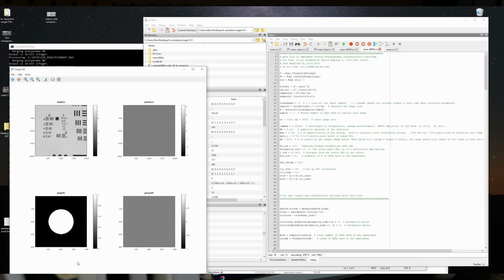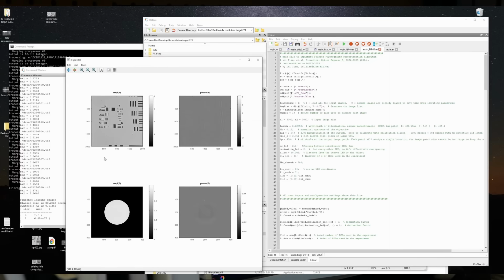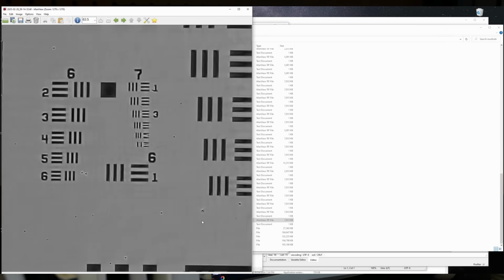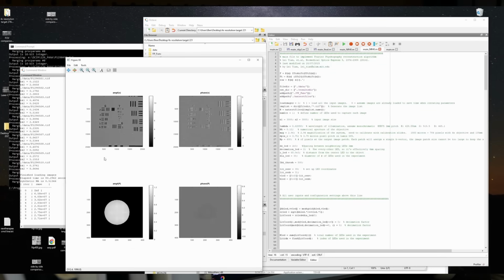Now the challenge is that we need to know the phase information to do the inverse Fourier transform, and we don't have it. There's no way to get it because we don't have phase-sensitive image sensors. So we have to guess and then go through the whole process and check if there's errors when we're done. And we can do that because we have the bright field image. So if we do the inverse Fourier transform of this assembled image, and then we check it against what we actually received in the bright field, and there's errors, we can incorporate that into our phase estimate and do the whole process again. So it typically takes about 10 iterations, but the benefit is that we also get phase information out of this whole process.